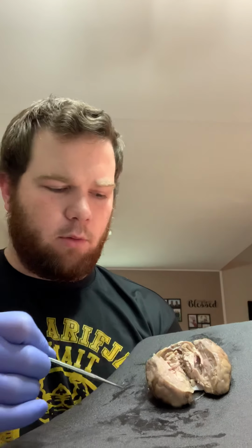Alright, I just completed the dissection of the brain. I didn't completely tear everything apart so that we could see the brain as a whole. First thing, we'll get orientated with the brain. This is the anterior portion up here, posterior portion back here. First thing that we're going to take a look at is the frontal lobe. That is obviously the one right in the front here. Both sides have the frontal lobe.